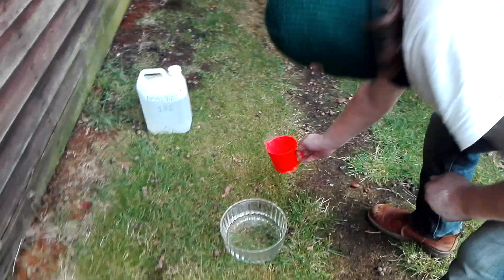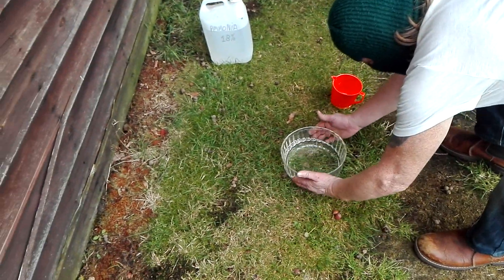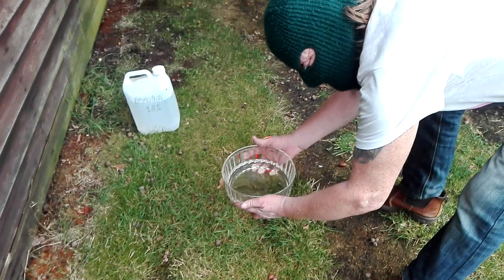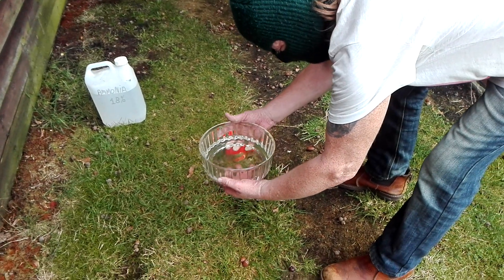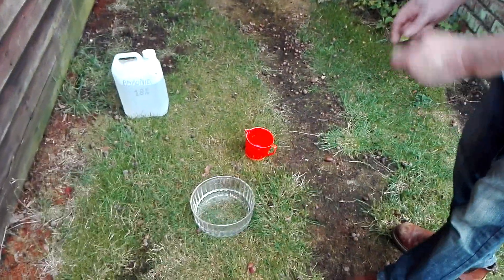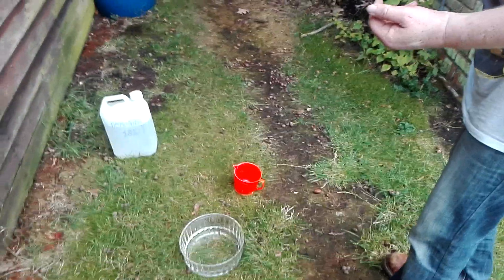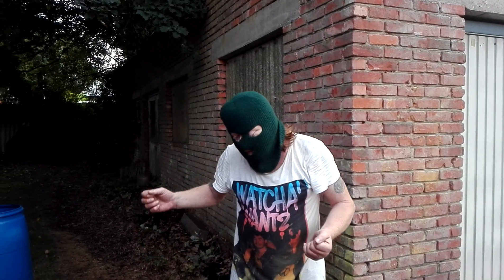When this is all over and done, remember this was all at room temperature. Now it feels pretty warm to the touch — I would say about 30 degrees Celsius, round and about. All it has to do now is work itself out and then evaporate. When it evaporates, a solid white crystalline structure will appear.